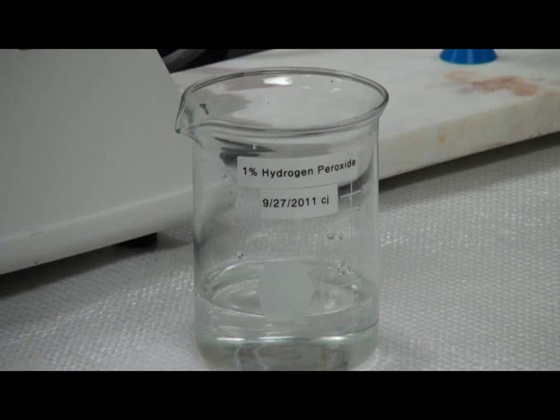Any solution not stored in its original container should be marked with the following: the name and concentration of the solution or material, date placed into the container, and the initials of the person creating the label.